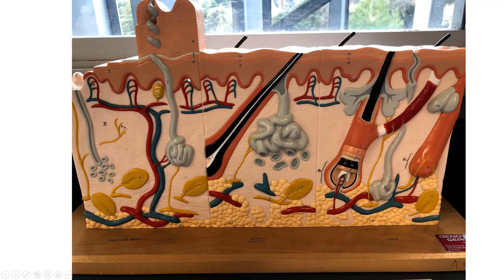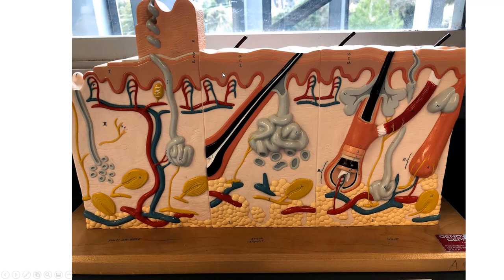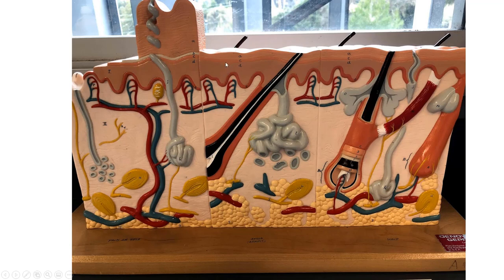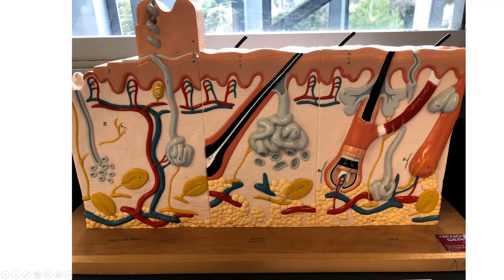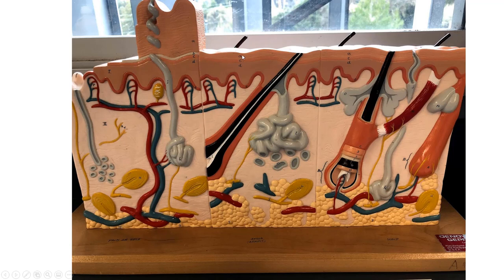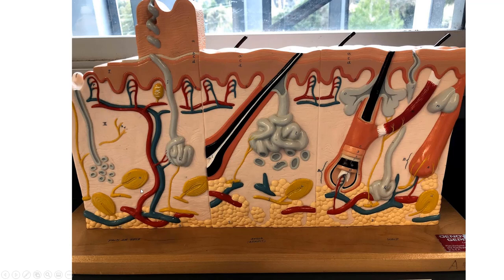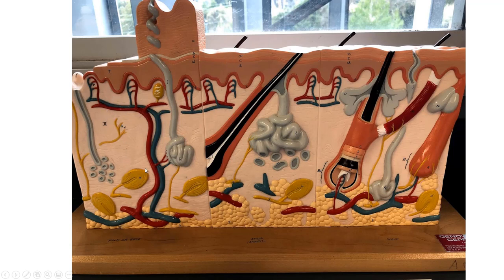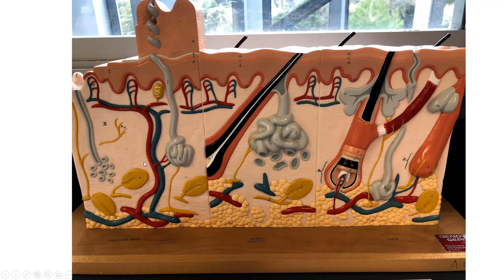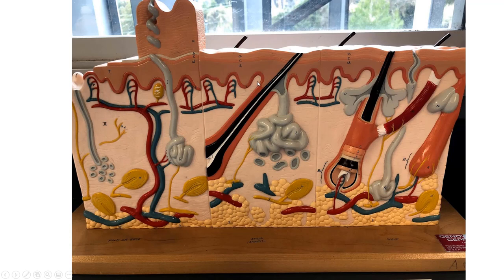The epidermal layers are stratum basale, stratum spinosum, stratum granulosum, and then stratum lucidum — only in thick skin — and then stratum corneum on the surface. As far as the dermis goes, we have the papillary region and the reticular region. The papillary region is areolar connective tissue with dermal papillae.